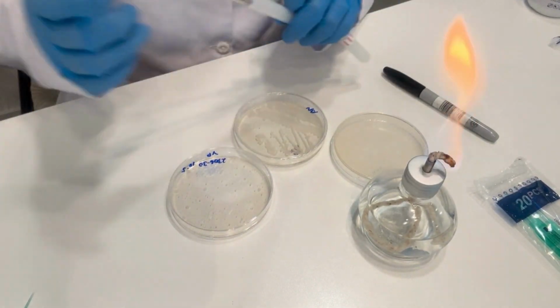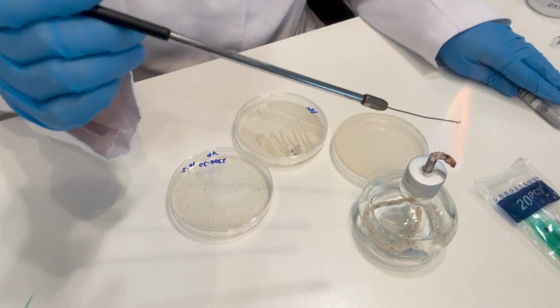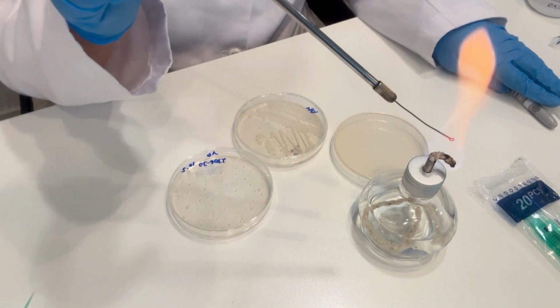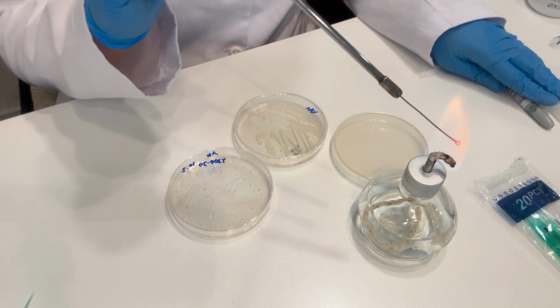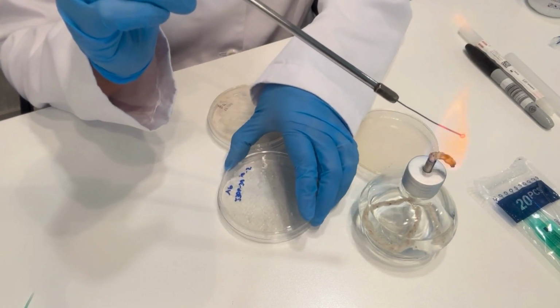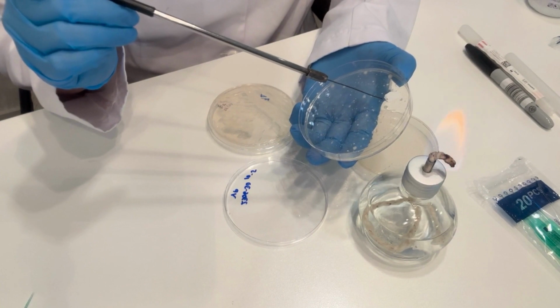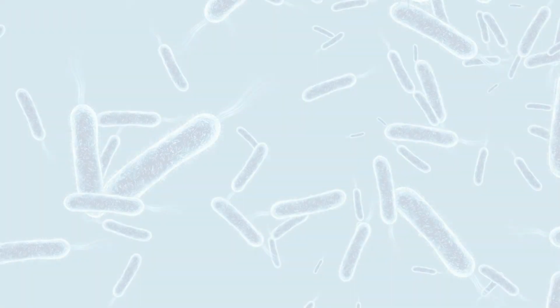Before using any of these methods, remember to take into account the nature of the microorganism you wish to isolate. If it is a fungus, it needs special agars such as potato dextrose. If it is a bacteria, nutrient agar is used. If it's an algae, it also needs special agars and special growing conditions. If they are mycorrhizae, remember that they are microorganisms that grow only in living plant material and cannot be reproduced in vitro.